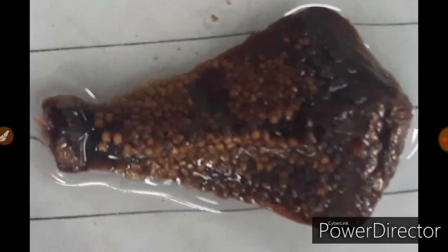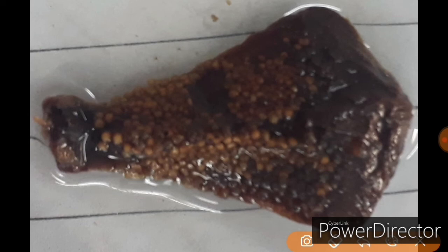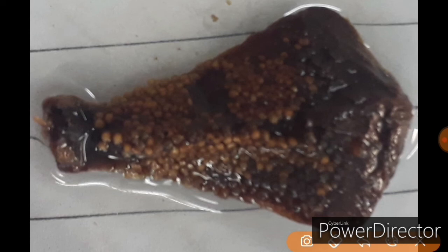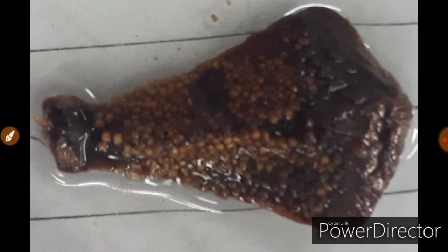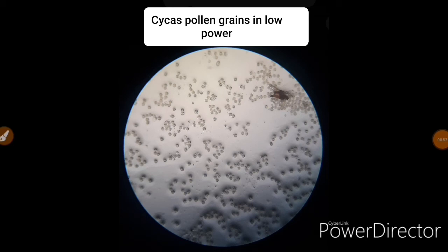This is a microsporophyll of Cycas. As we have discussed in our previous video, the microsporophyll consists of two sides — an adaxial side and an abaxial side. On the abaxial side we have microsporangia in the form of a sorus, and within the microsporangia there are microspores. This is the microsporophyll of Cycas.